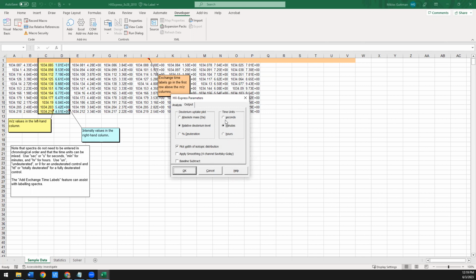The time units, you can use whatever's comfortable for you. It has a smoothing option. I would recommend you smooth the data beforehand. Most mass spec software has probably more elegant smoothing than this software does. It can also do baseline subtraction, but again, if you can do this before you import the data, you're probably better off.